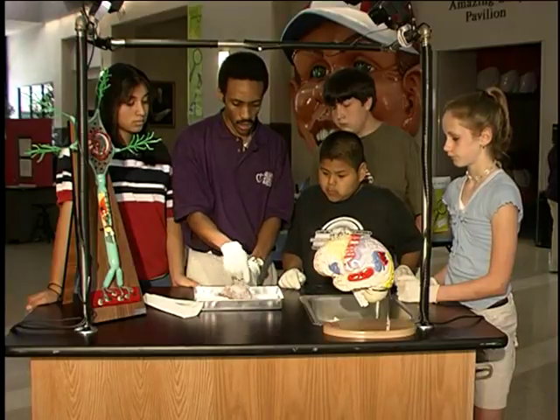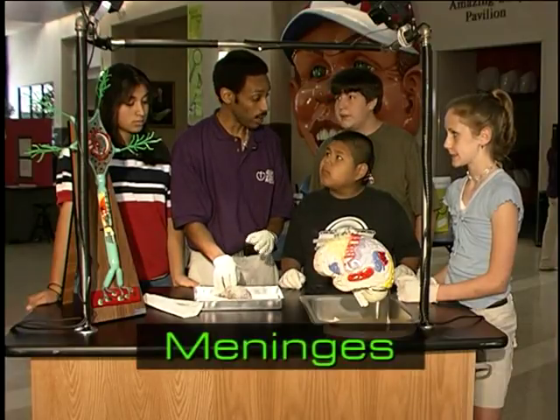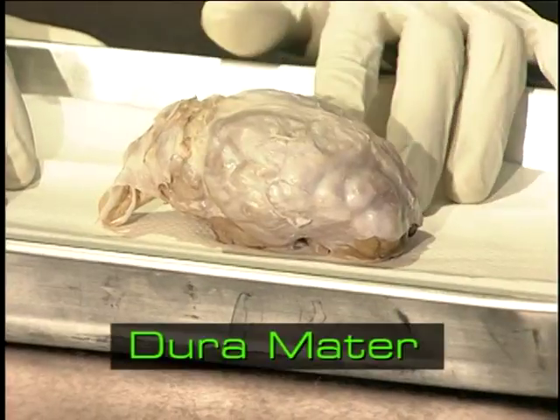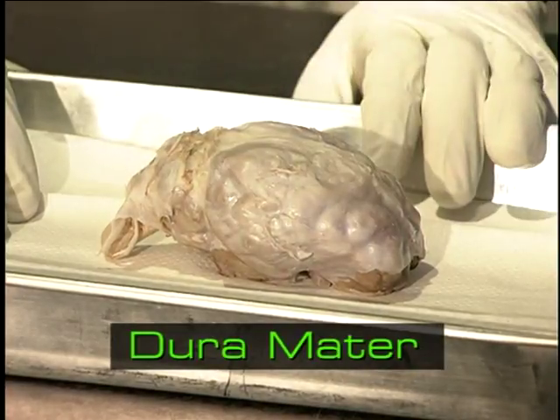As we can see, it looks like the brain is wrapped in something, kind of like a white sheath. This is actually 3 layers of skin that cover and protect the brain, and we call these the meninges. The outermost layer of the meninges is called the Dura Mater. That's the tough, fibrous portion of the meninges.